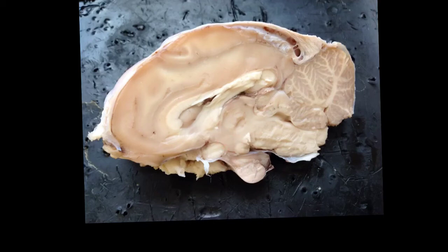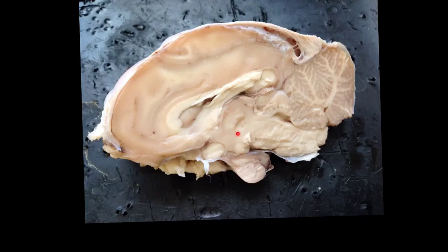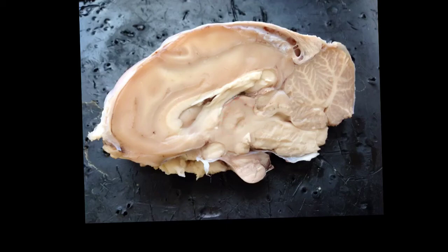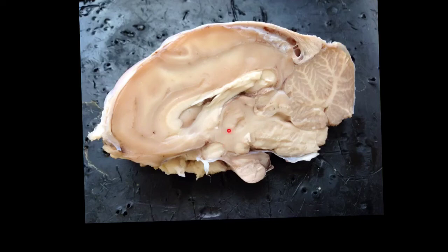The thalamus is this nice, more oval region that actually protrudes laterally, so we're cutting through the middle of it here. To confirm your reasoning, always try to find this nice circular thalamus right in the dead center of the brain, and then just below it is the hypothalamus.